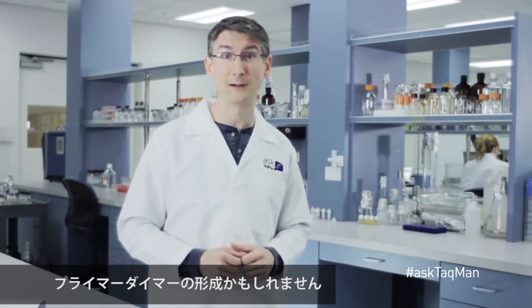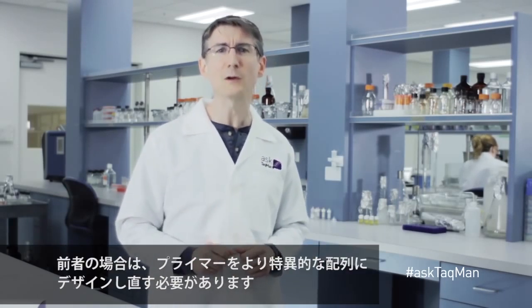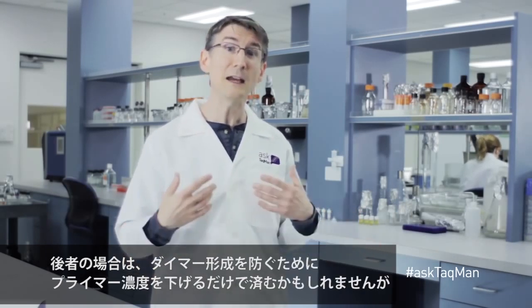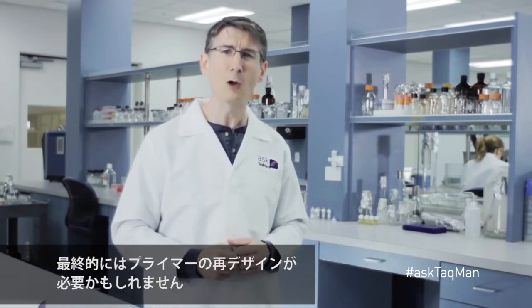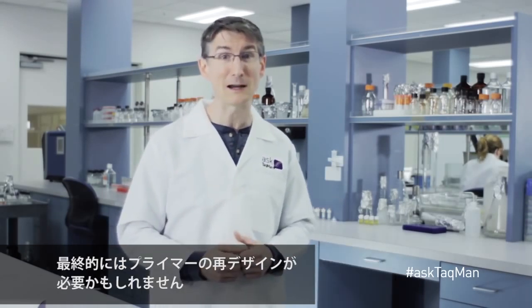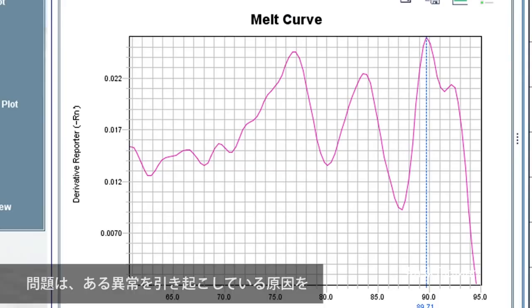So what causes extraneous peaks? It really depends. Often they're caused either by non-specific amplification or primer dimer formation. In the first case, you'll need to redesign your primers to a more specific sequence. In the latter case, you may simply need to lower the concentration of primer to discourage dimer formation, although a primer redesign may ultimately be necessary.